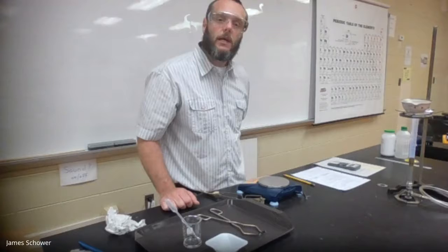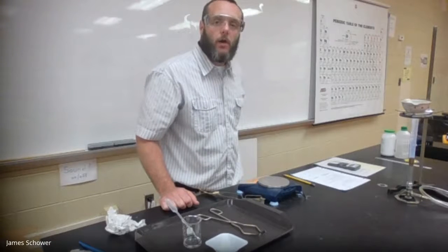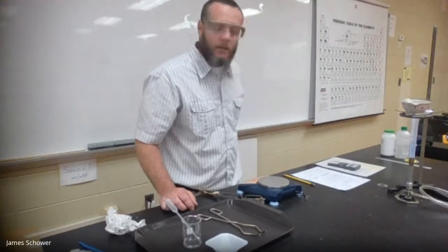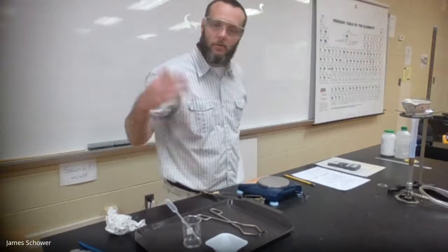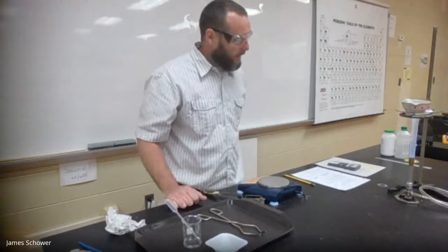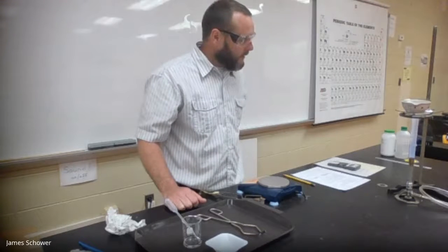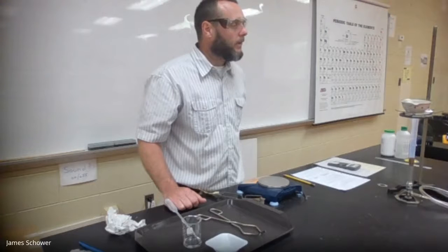That way, we can accurately measure the sodium chloride, NaCl, which is left over. If you note in the balanced equation, sodium chloride is your solid left over, whereas the water comes out as a vapor and CO2 comes out as a gas. I'm going to let it go for just a minute. You'll see the evidence of the water coming out.